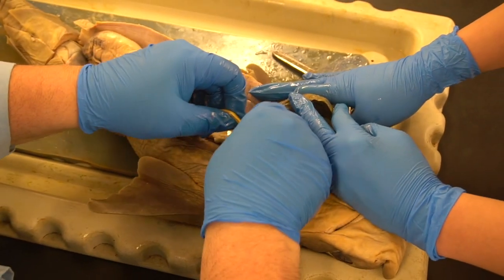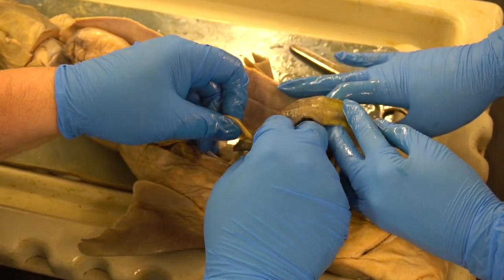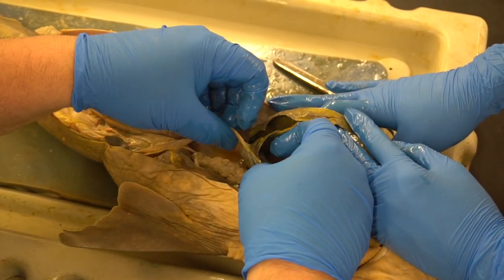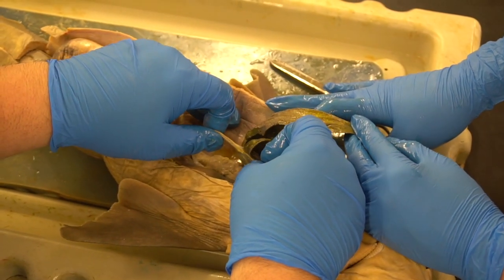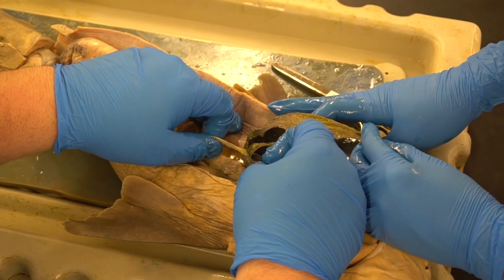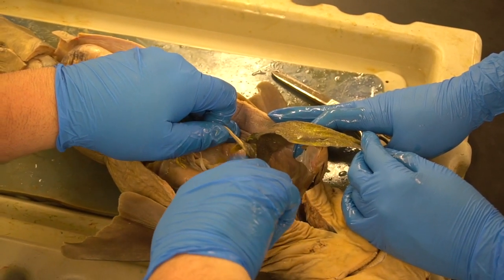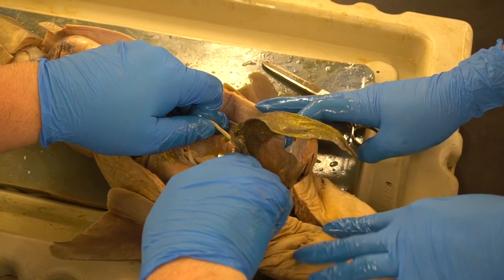There is a gallbladder. Okay, we have that too. It's a storage for bile. It's located posteriorly here. Later, if we remove the liver, we might be able to see it a little bit better. But it's like a sac-like structure that stores bile while the shark is waiting to use that stuff to digest. Okay, in the current state, it would obviously be nothing in there because the shark is not with us anymore. So there is no bile left in that sac.